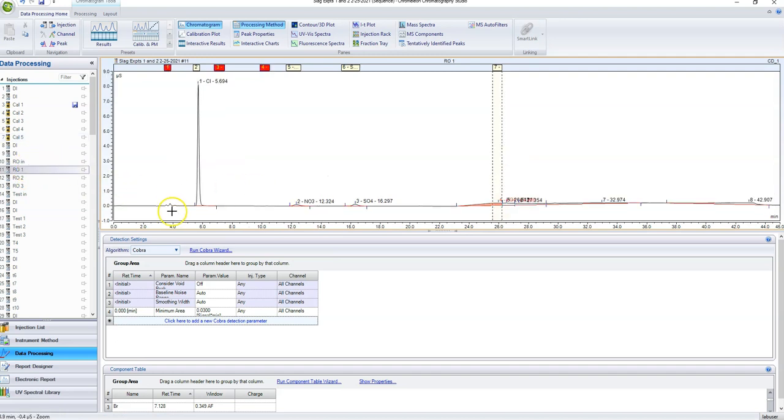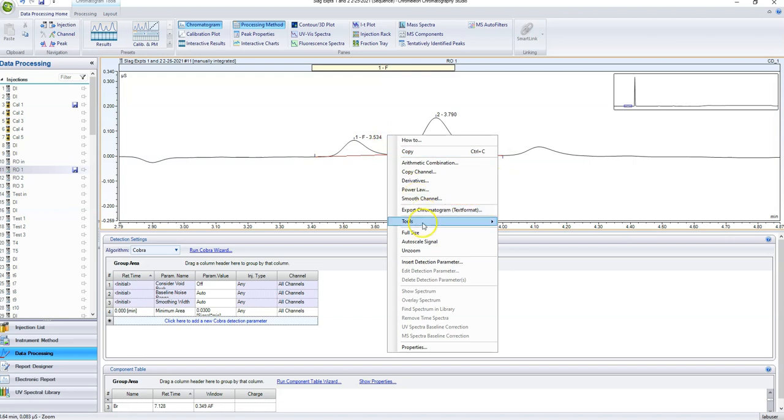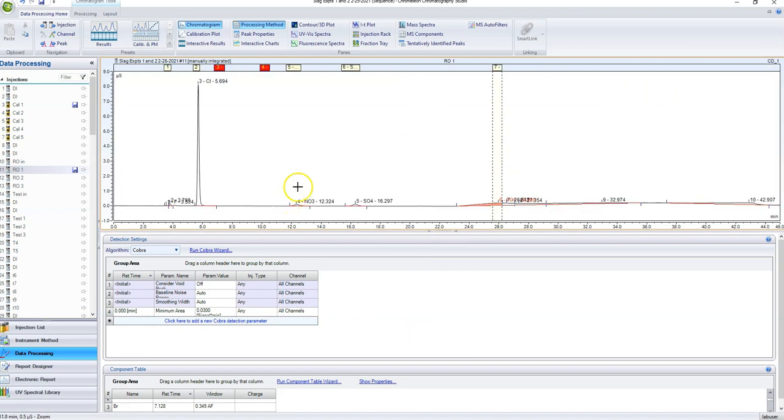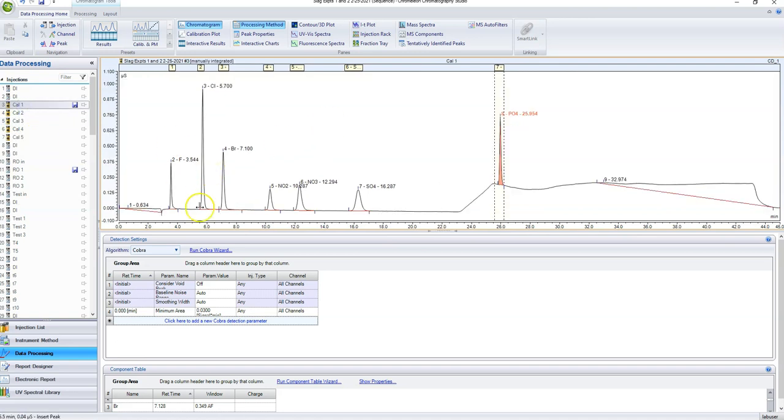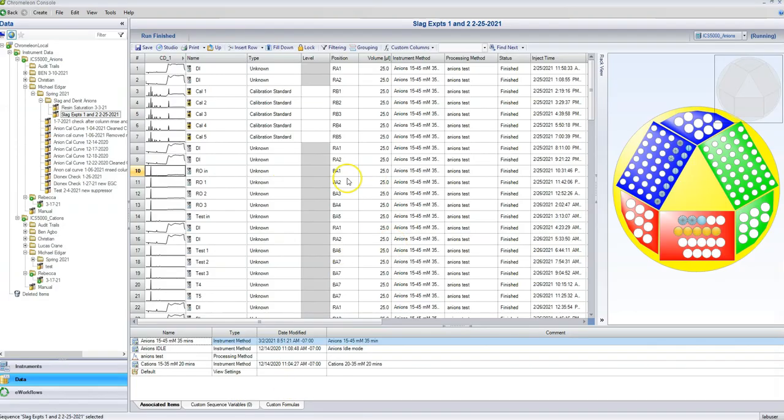We can look at some of our actual peaks. So like, see, this fluoride peak was actually too small. So there's multiple peaks here around the fluoride, and we'll talk about something like that later. Chances are one of these is fluoride and one or two of them are small organics. But like I said, we'll talk about that later. So now that we know that our calibration plot looks good and all of our peaks are selected accurately, it is time to tell it what our concentrations are. So we have to go back to our data. Remember this thing? And now that we've assigned a processing method, see how our processing method is here, we now have levels for our calibration curve. These need to be levels 1 through 5.